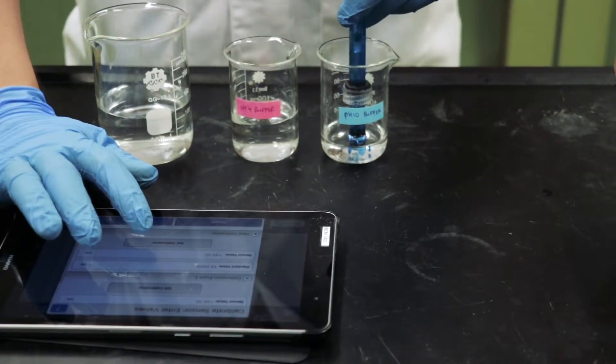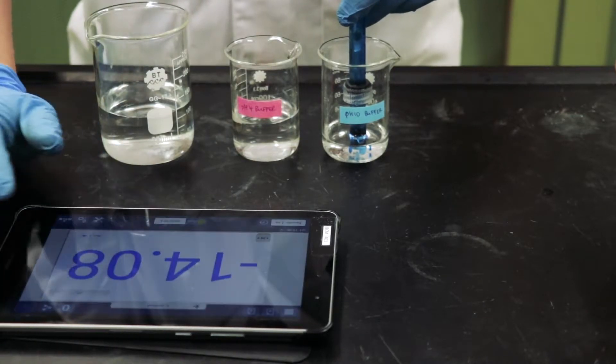Select OK when both standard values have been calibrated. Now, you may carry on with your experiment.